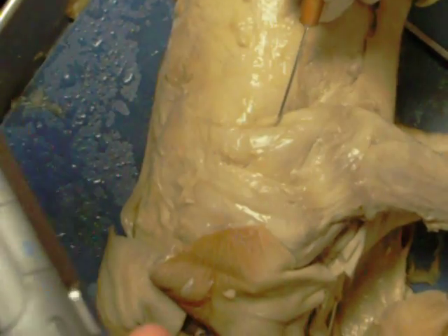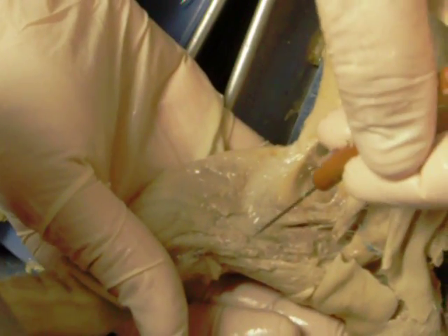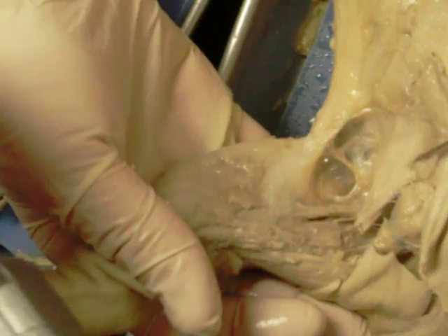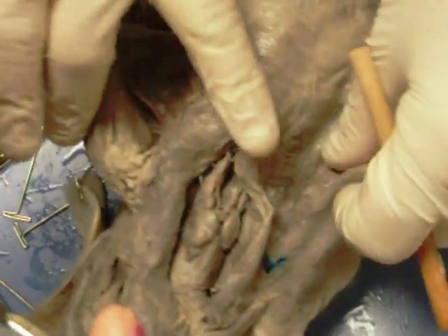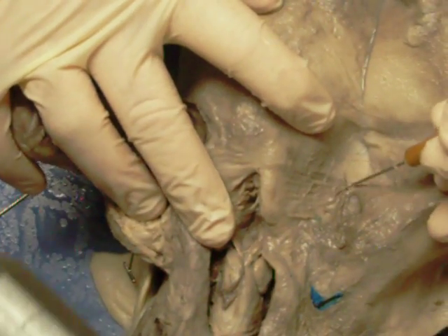We have the triceps over here — triceps brachii — and then we have the deltoid. If we look on the inside, we have the biceps brachii. The pectoral muscle has been cut away on this one. Going back to the other pig, we can see the superficial pectoral shown right there, and there's another shot of the biceps.